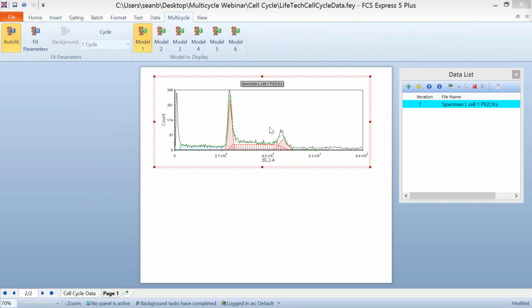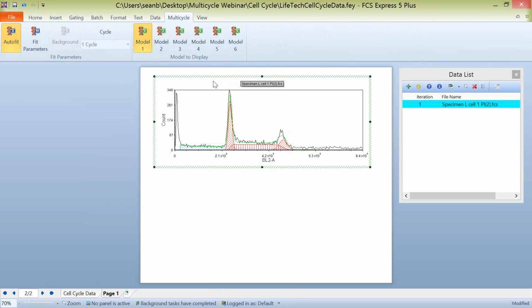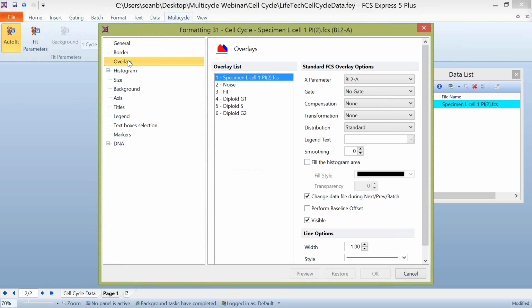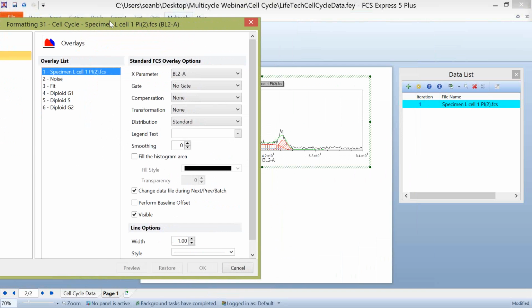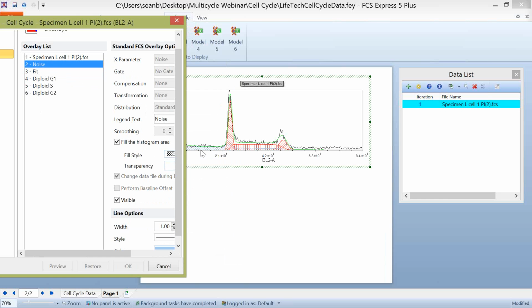So let's first talk about these different overlays or these different displays on this plot. If we right-click on the plot and choose Format, this is where you can access all of your formatting information, really for any plot in FCS Express. But if we come into the overlays of the multicycle plot, you notice that we have our different overlays indicated here. So our noise parameter or our noise fit is going to be this hatch blue mark, which you can see down here on the left. Multicycle is determining what is going to be noise in this assay. The fit is being determined as a green line, which is the green line that we've defined here. And of course, our diploid G1, S, and G2 phases.